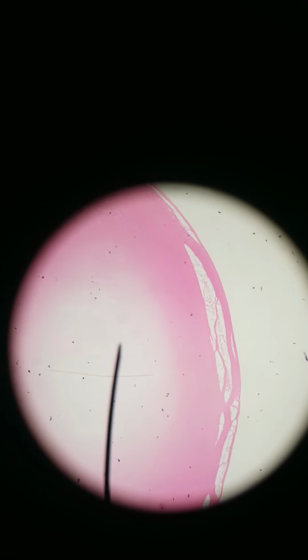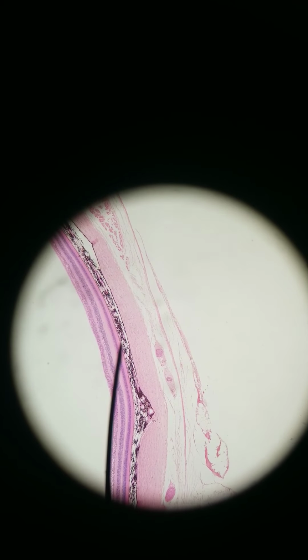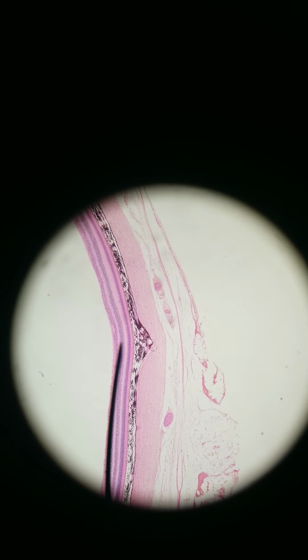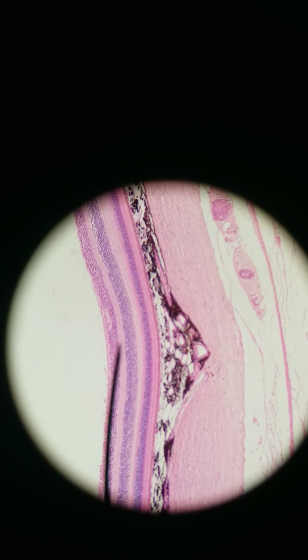In the eye and in other areas of special senses, we have special neurons called bipolar shaped neurons. Bipolar means it's a lot like the multipolar. You've got dendrites on one end, axons on the other, but there's only one or 2 dendrites and then 1 axon, and they're very, very short. So this occurs in the retina. It also occurs in the nasal epithelium.